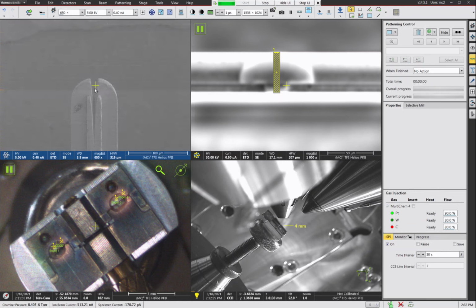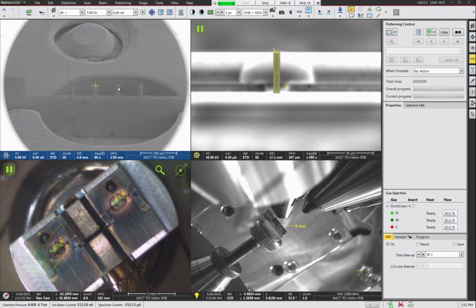So this way I can tell which posts are which, because I'm not going to put a notch in this one. So we would have the sharp post as number one, and that one would be next to my marker post. And then the post over here that's next to a regular post would be post number two.